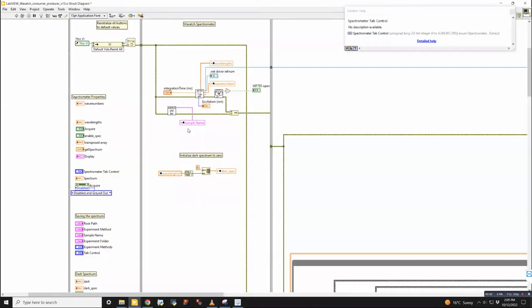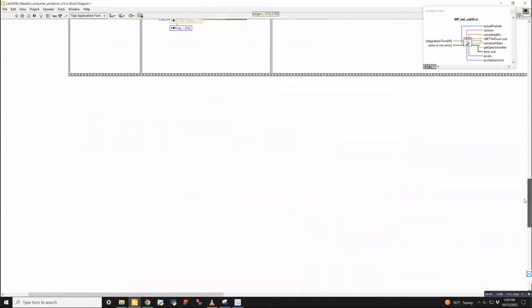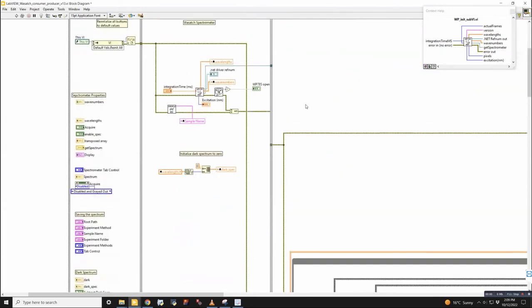So the reason the sub VIs are nice is if I look at this, I'm like, okay, this is the initialization for the spectrometer. And then down here is the initialization for the K-cube. And all the details that I just showed you in the sub VIs here are not really important for you to understand how the overall software works. It's kind of hidden in the background because all I know is that this thing here turns on the K-cube and gives me some settings about what they are when it boots up. And same thing for the spectrometer. And that's it.